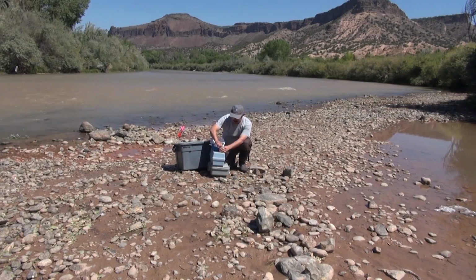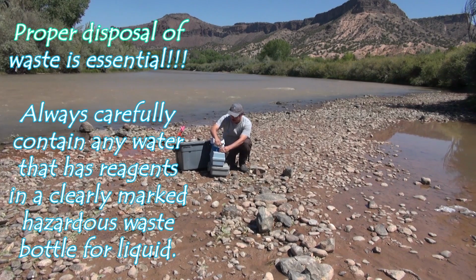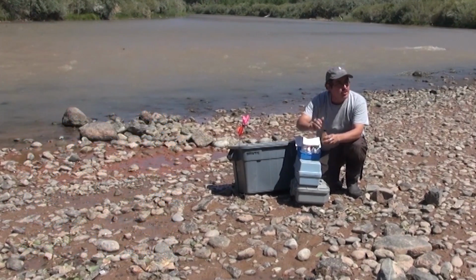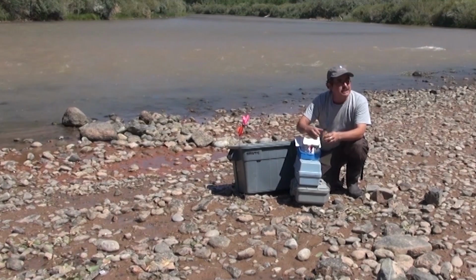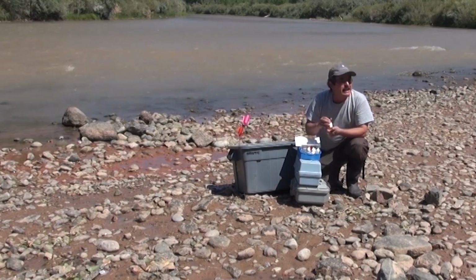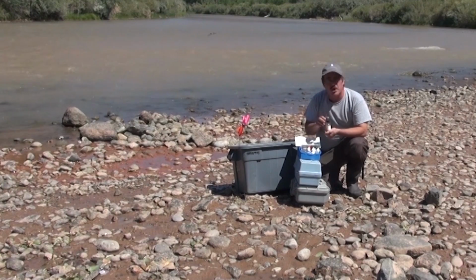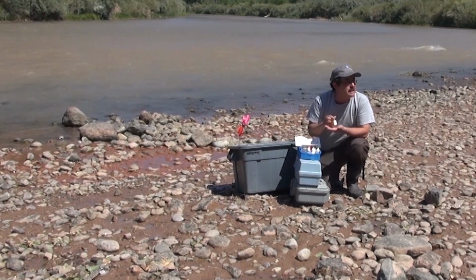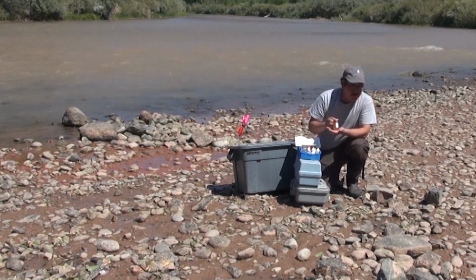So one other thing to consider as we're running samples that require using chemicals that could be toxic or hazardous to the environment is to take special care that we're utilizing them properly and that we're not spilling them on the ground. And even after we run these samples, any waste that we create is going to go into a waste bottle. The waste bottle just helps us to keep any hazardous materials or chemicals that we're utilizing out of the environment.